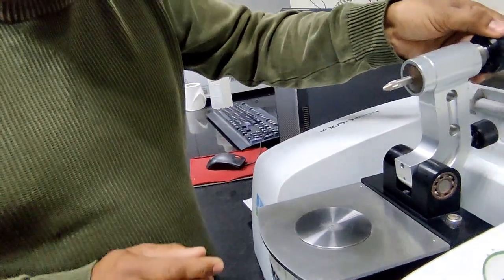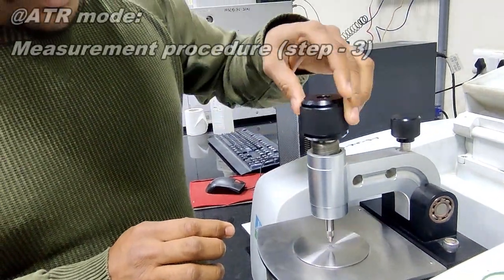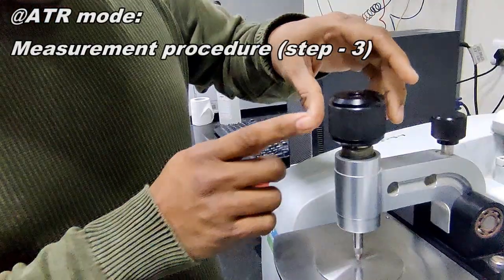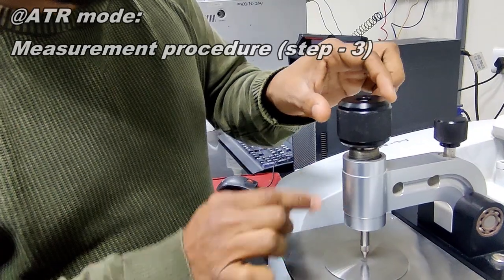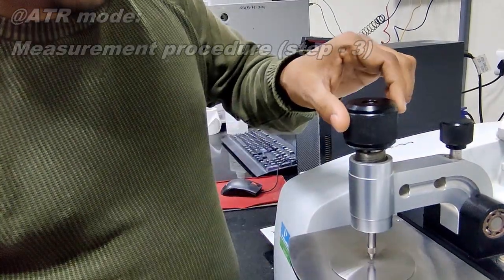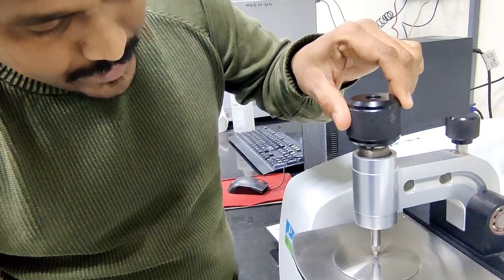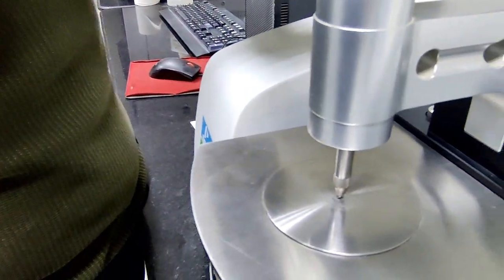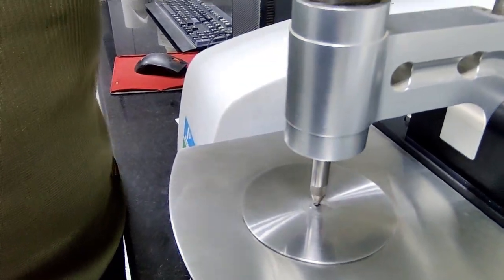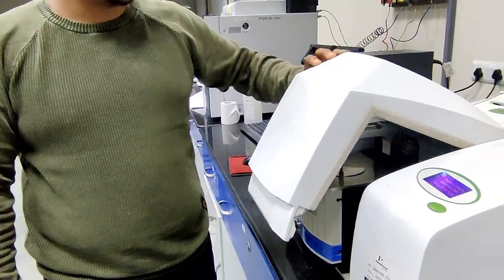Then, above this sample, we have to use this. This tip has to touch the sample. For that, we have to rotate this rotator. Ensure that this tip is actually connected with your sample. Then close this instrument cover.